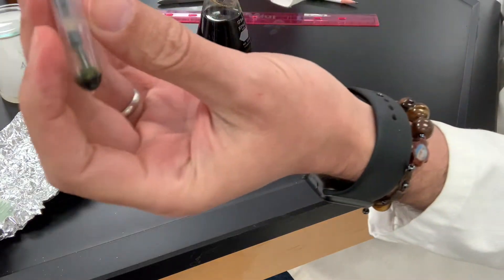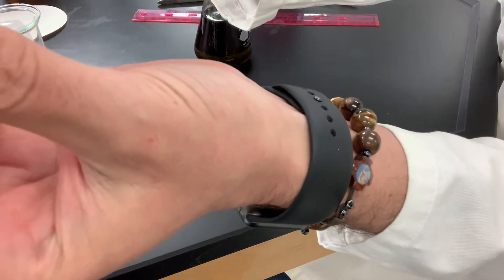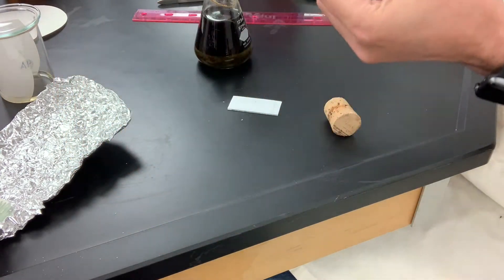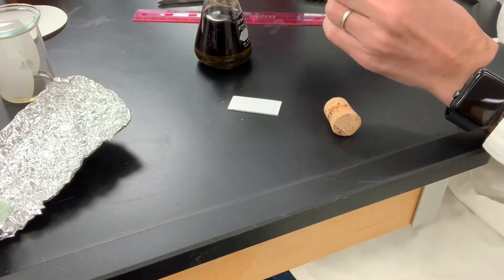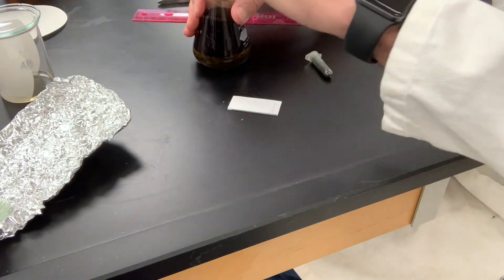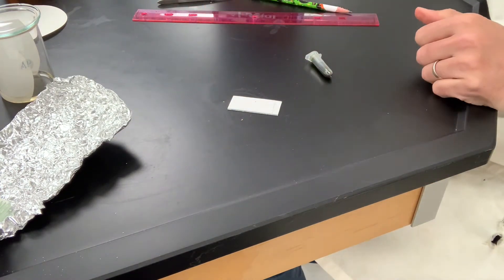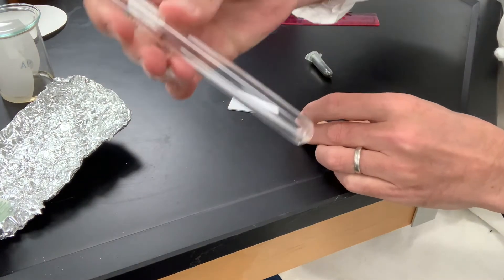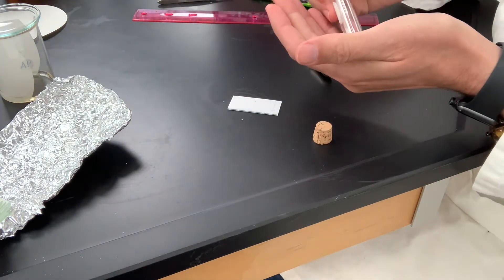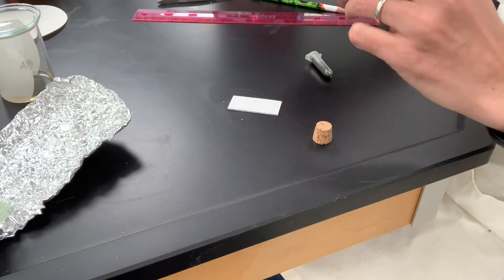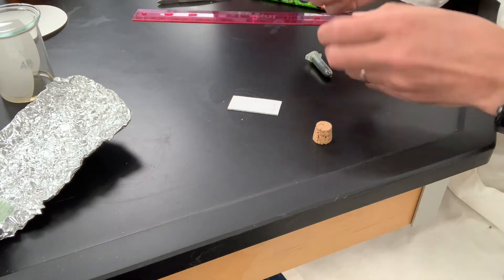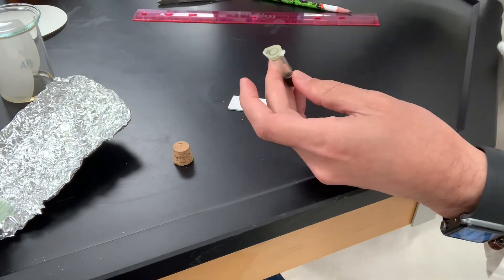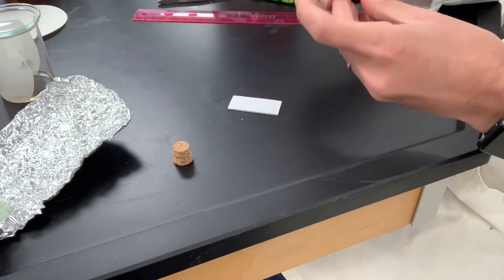Of course, very dark green because of the chlorophyll. Next, we'll grab one of our capillary tubes that we drew out. And like I said in the demonstration video that I made, we're going to spot this on the TLC plate and blow gently to evaporate it.